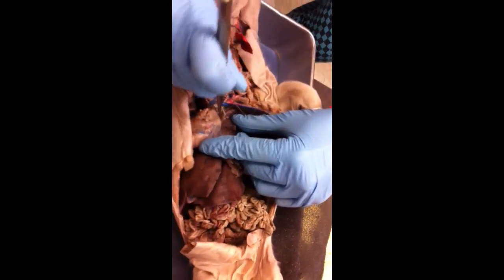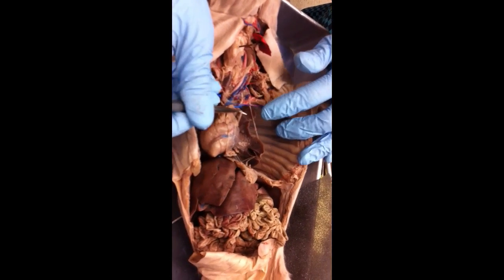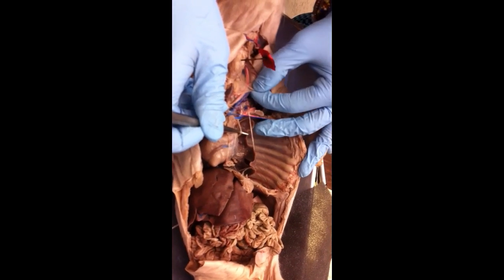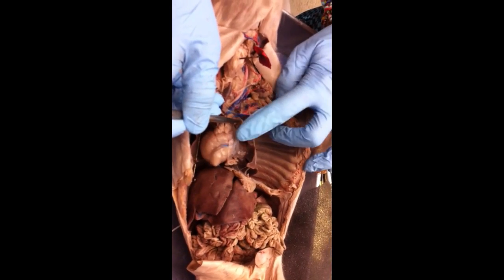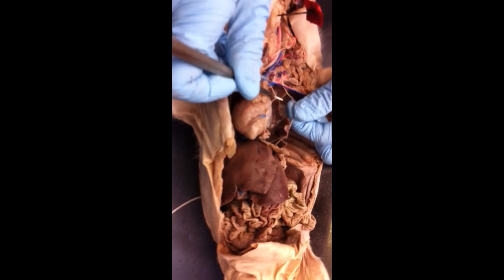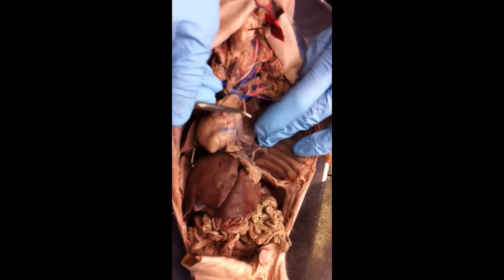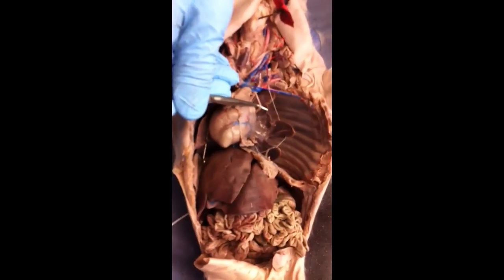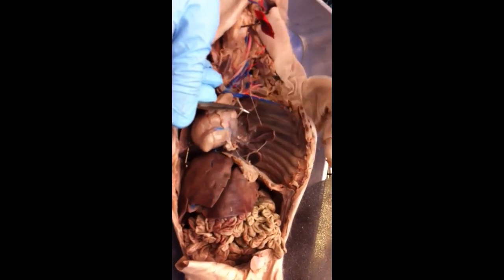Then the other one you're going to see is the vagus nerve. And vagus nerve, it innervates the heart, but it also innervates the digestive organs. But more than likely, if I pin it for you guys, I'm either going to put a string around it close to the heart. And you can kind of see how it's thicker than the phrenic nerve, but you might not necessarily be able to compare both of them on a structure. So this one's vagus nerve. You can say for a function that it innervates the heart to regulate heart rate. Okay, it actually has parasympathetic control on the heart rate. It's going to decrease heart rate.